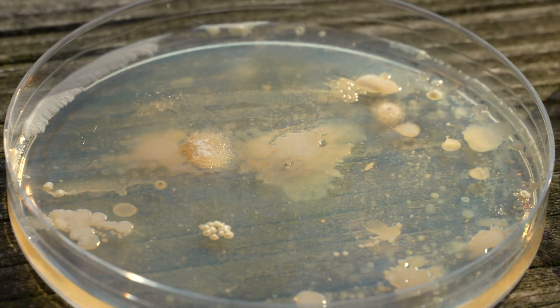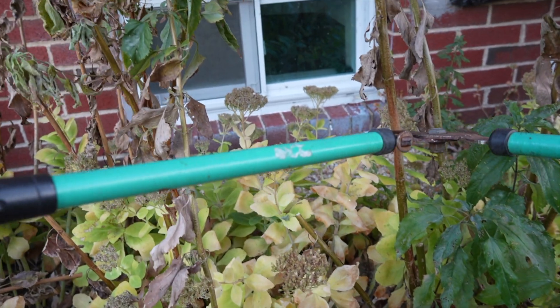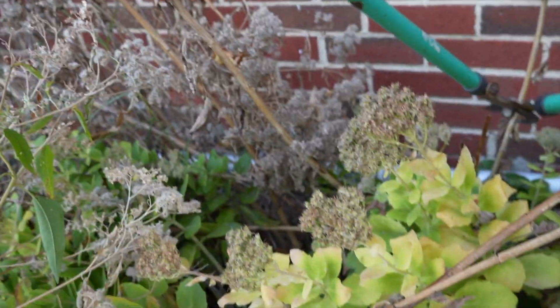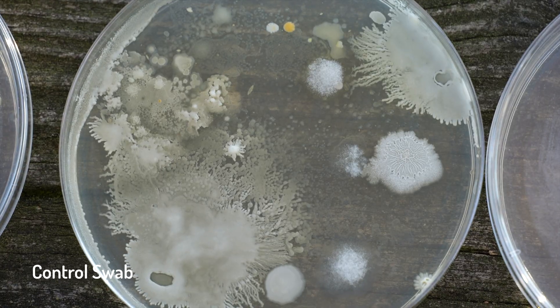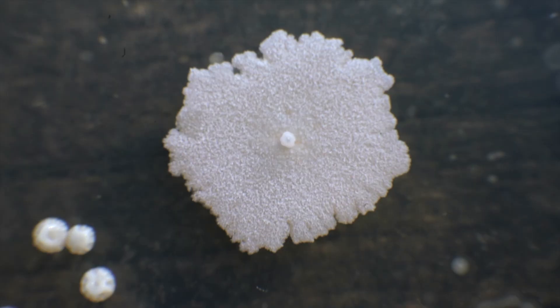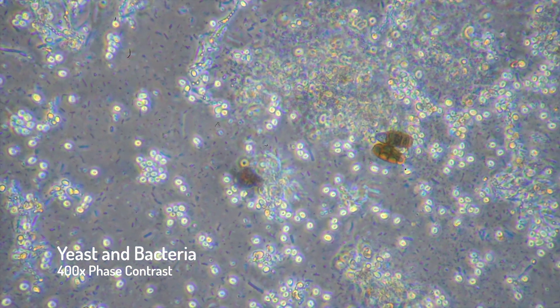But what about after 24 hours of literally zero hygiene? After my meal, I basically just brushed my teeth and went straight to bed. Four and a bit hours later, I was awake once again to swab my hands for science. A sniff test also confirmed that I did indeed eat buffalo wings last night. In the 12 hours after that, I went about my normal routine: brushed my teeth, took a dump, worked a little bit, and even did some gardening. In my morning sample, you might notice it looks quite similar to the control swab and the post-run swab. I think this combination of fungi, bacteria, and yeasts might just be my skin's natural microbiome. After sleeping, my skin has had time to come to homeostasis — find its own balance. This collection of microorganisms has likely out-competed anything else that was growing there.